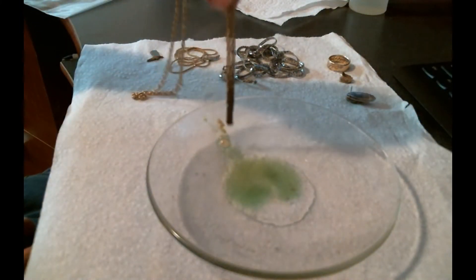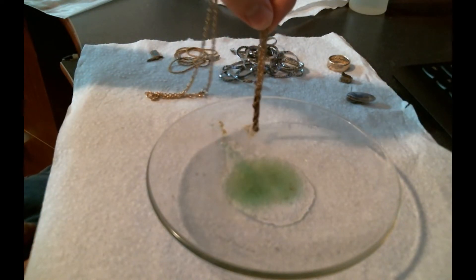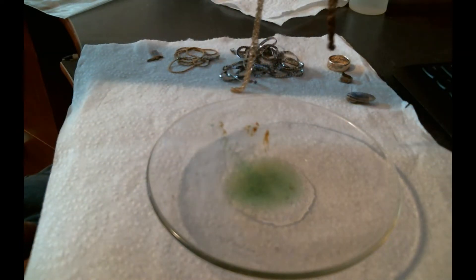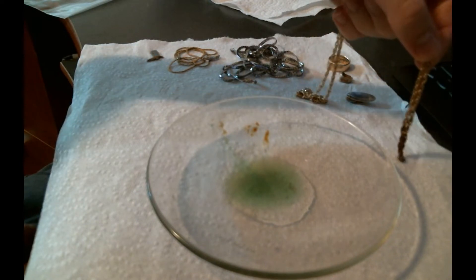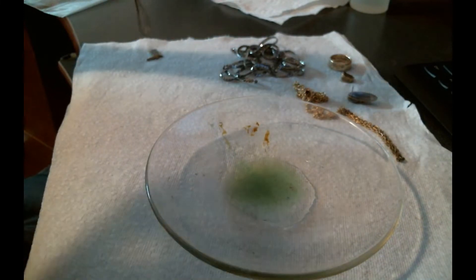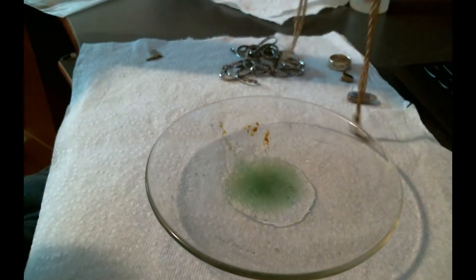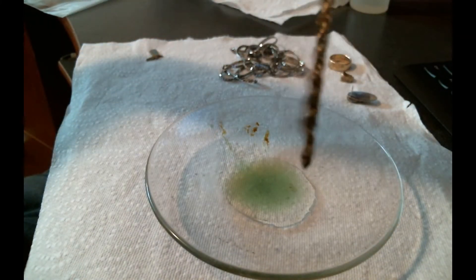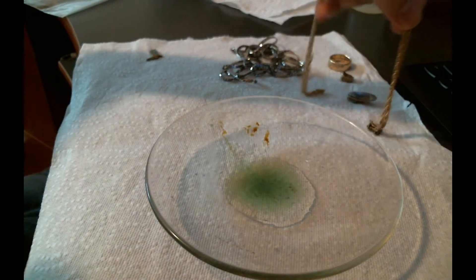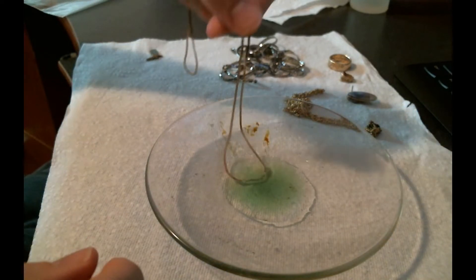All right, that's enough of that. The gas is very strong. It's NO2, NO3 gas and it's not very good for you to breathe, so you don't want to do it too much. You can see that it changed the color of the liquid and changed the texture of the gold plated object. I'll rinse that off later. If you get this reaction, you do not want to buy the object for gold prices.